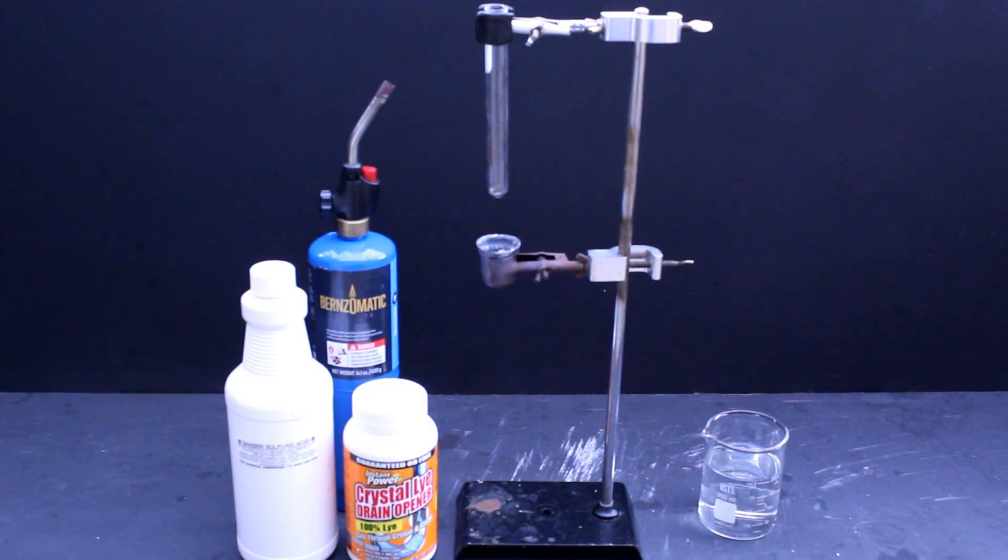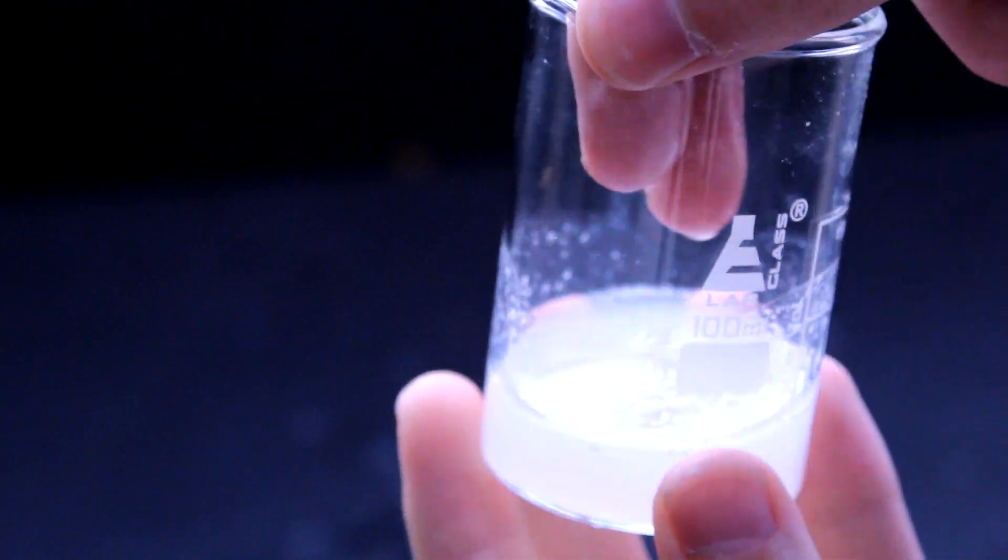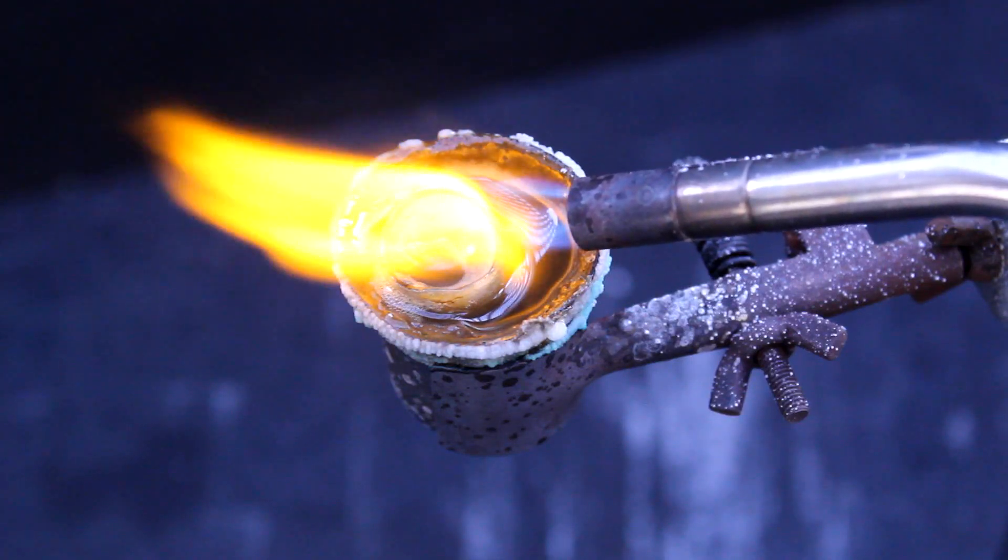Today, I thought it would be kind of fun to turn one of my old glass test tubes into a puddle of slime. And no, I don't mean by melting it, although that is somewhat of a necessary step.